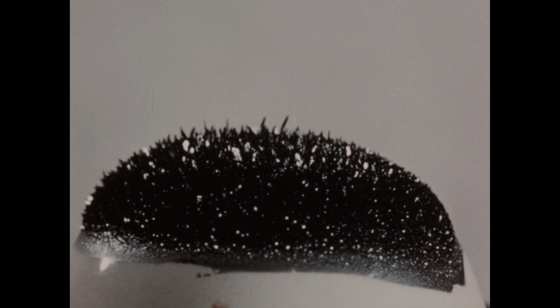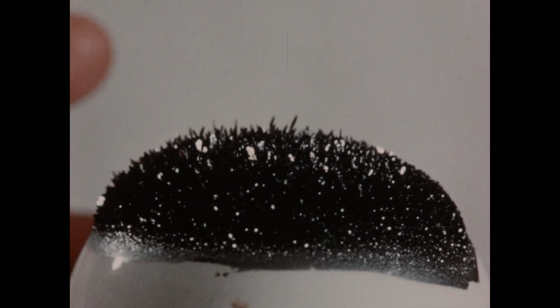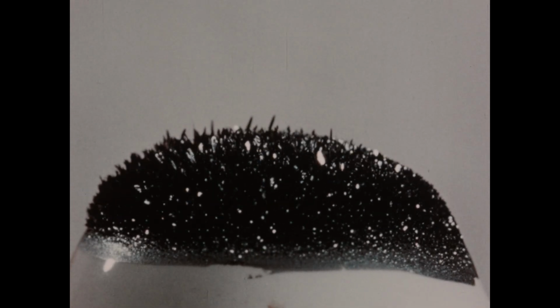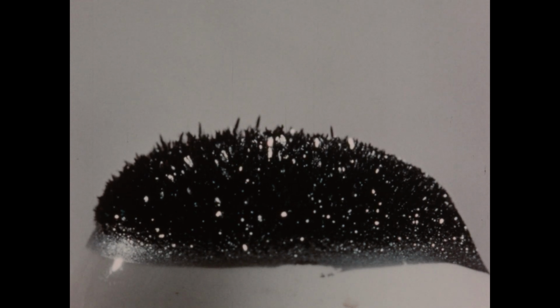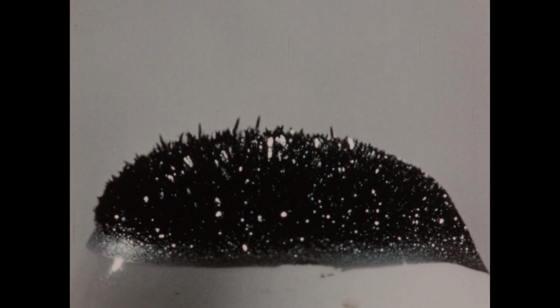We've removed the evaporating dish from the beaker and have inverted it here on the wire gauze. I'll rotate the dish slowly so that you can see the flashes of light from the faces of the crystals of iodine which are formed on the bottom of the dish. Notice that the iodine vapor condensed directly to the solid rather than condensing into liquid first. This is moderately unusual behavior.